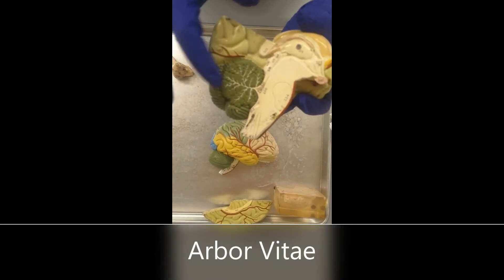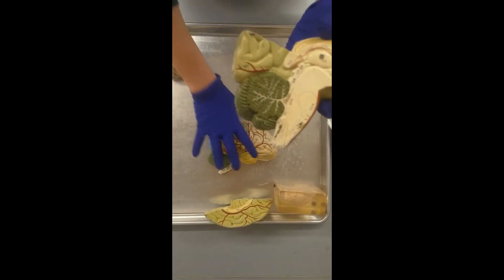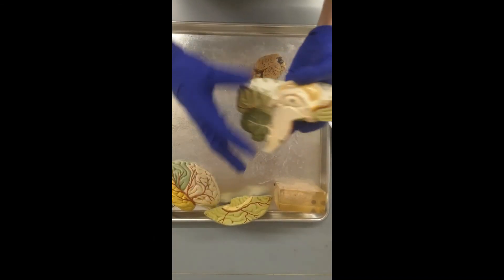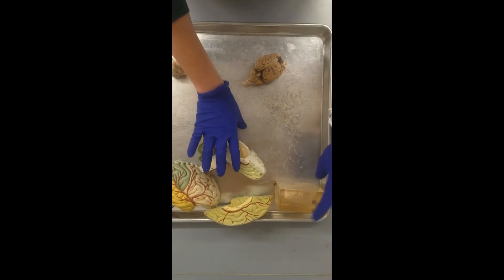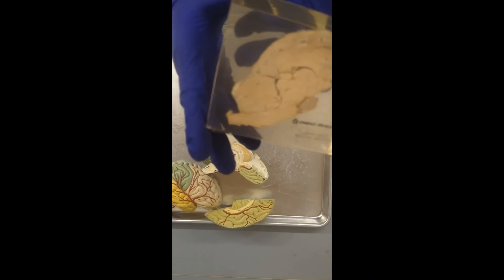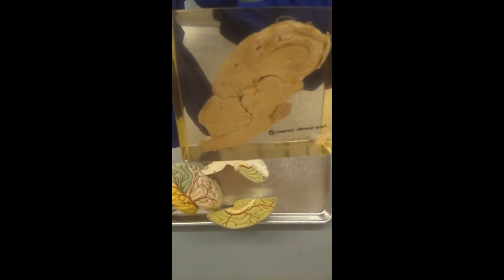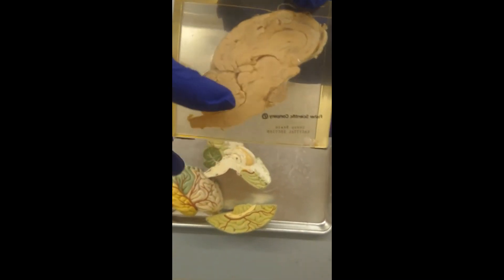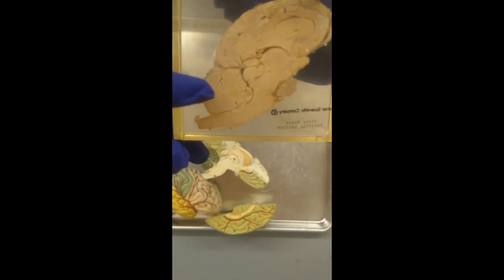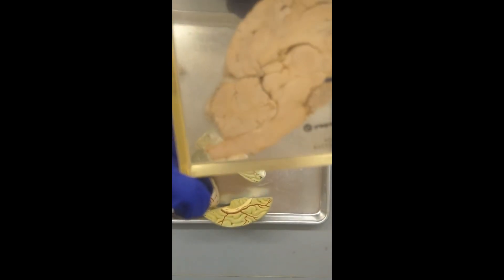The arbor vitae is all the branching white matter in the cerebellum. And I have my acrylic brain here — in the cerebellum you can kind of see the arbor vitae in there a little bit.